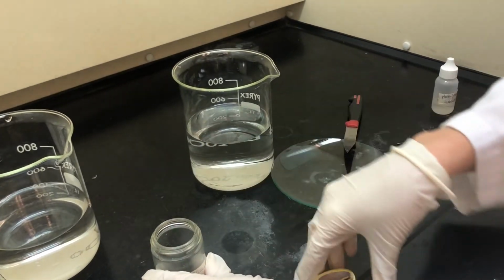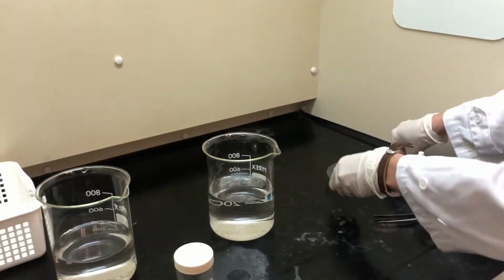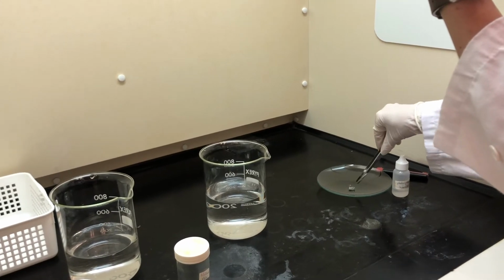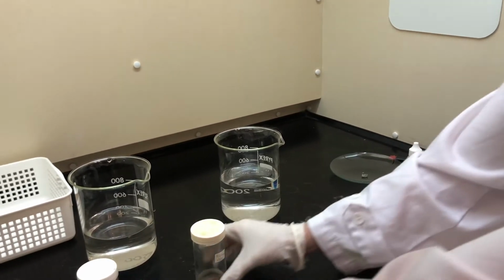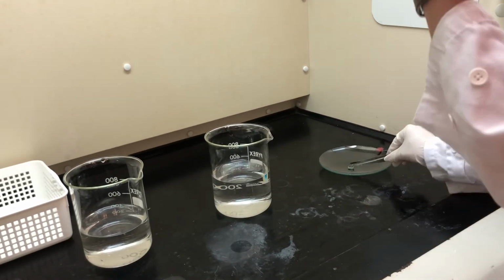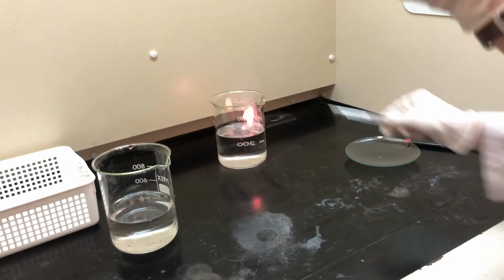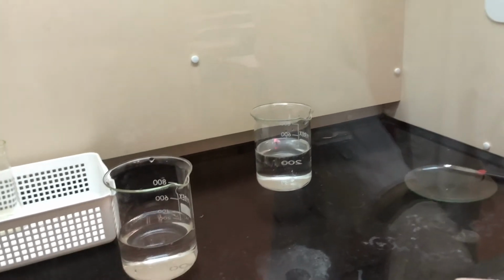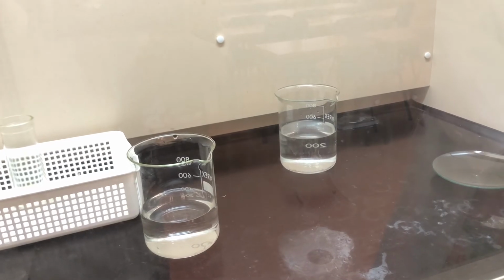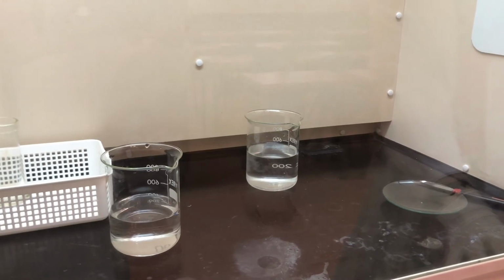And then what I'm going to do is place it into this piece of water, and we're going to observe what happens. And I'm going to pop the fume hood down, okay? So before we do this, we'll remove any other bits and pieces for it to react with. And you're going to write your observations, okay? 1, 2, 3, go. Okay, so we're doing this behind a safety piece of glass, okay? And you can see even that small amount is highly reactive, and you can see that it's still fizzing.